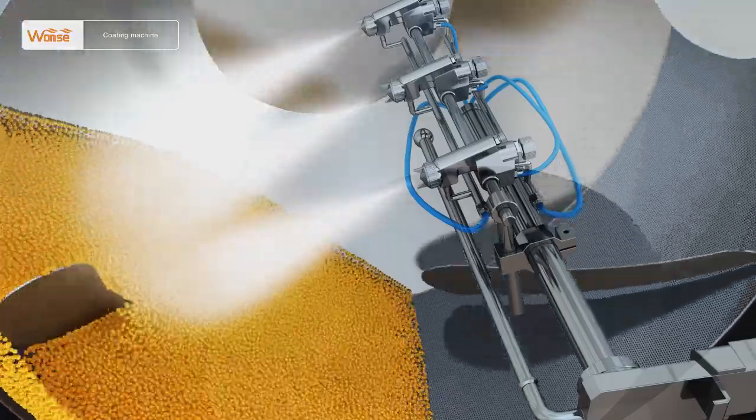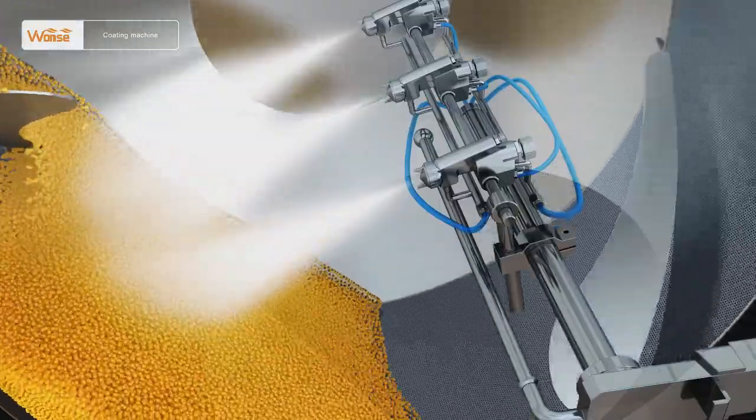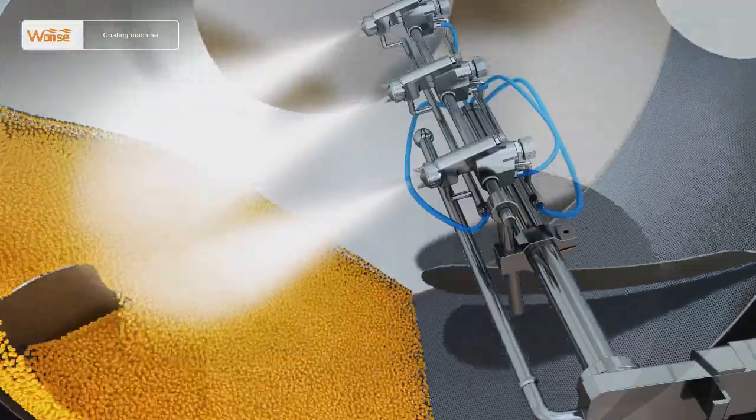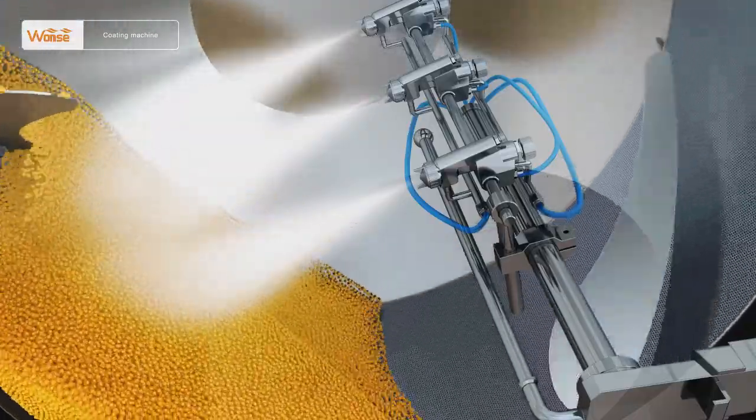Fourth, when starting the coating machine, start the spraying of coating liquids. The rotation speed at the initial period is generally from 2 to 4 revolutions per minute.